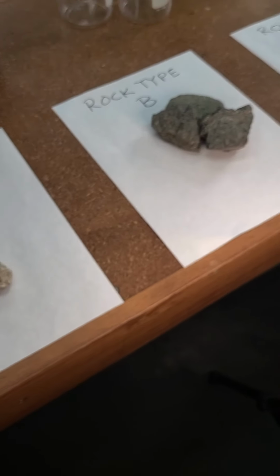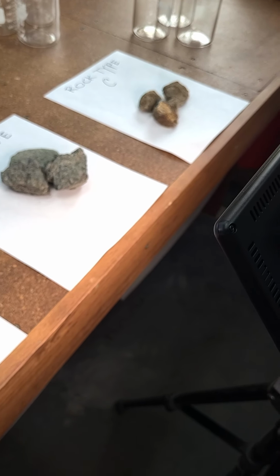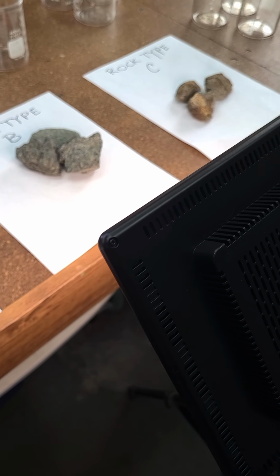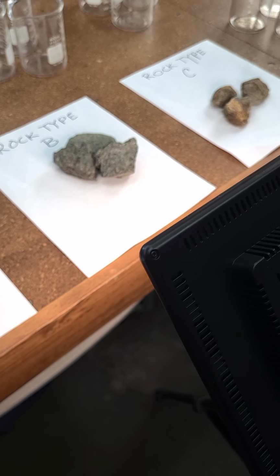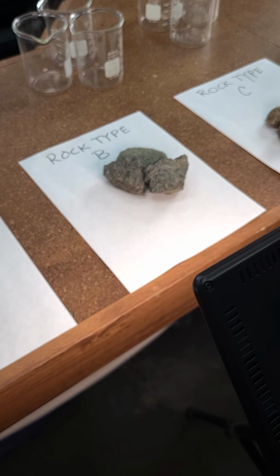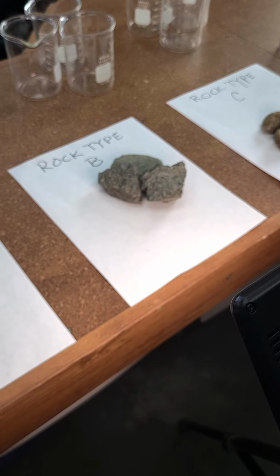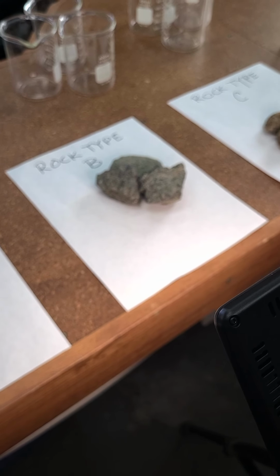The next part of this experiment is going to be, how does acid rain affect rocks, or how does a weak acid? If your soils are slightly acid, or you're under maybe forest soils, you might have a weak acid formed as a result of the coniferous forest, or if you're in an industrial area, sometimes we do get a little bit of acidic rain coming down. So what happens when you have a slightly acidic solution contacting the rock, will it help break it down? We're going to simulate that by using some club soda here.